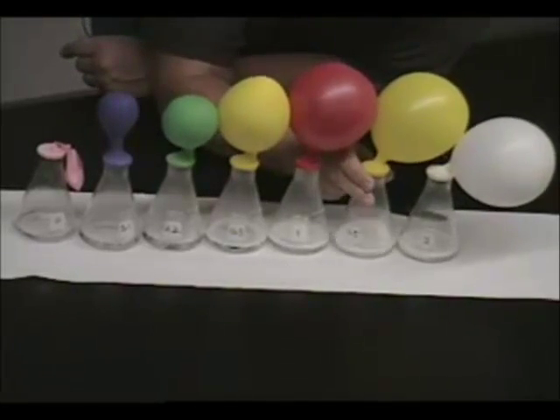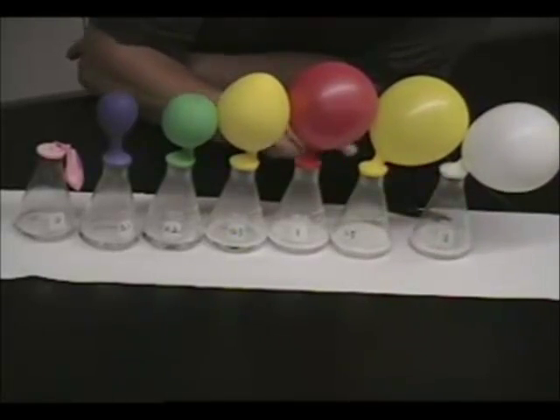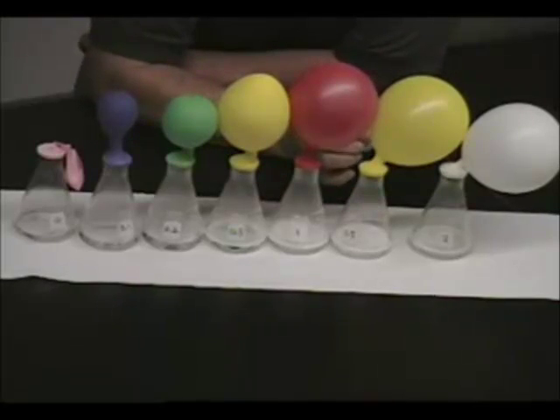Now, they're still going a little bit here. We'll let them go. They're not going to go too much longer. And by the way, one of the products of this is hydrogen gas. That's what's in the balloon.